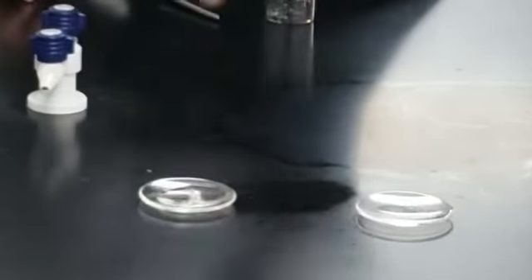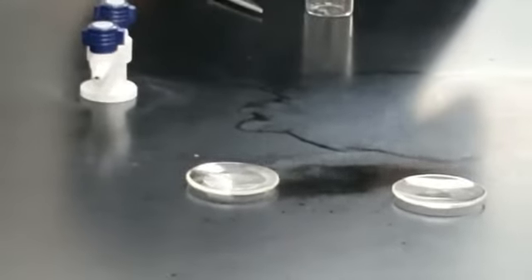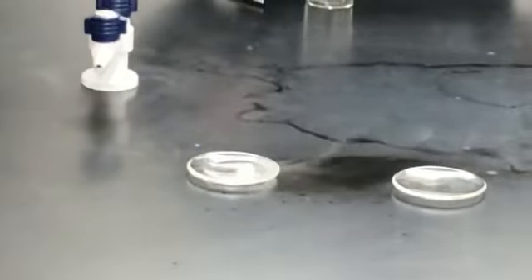So one more time over here — you can see what happens. The metal is completely gone and hydrogen gas is released. Hopefully you learned something about liquids, their properties, and their safety.